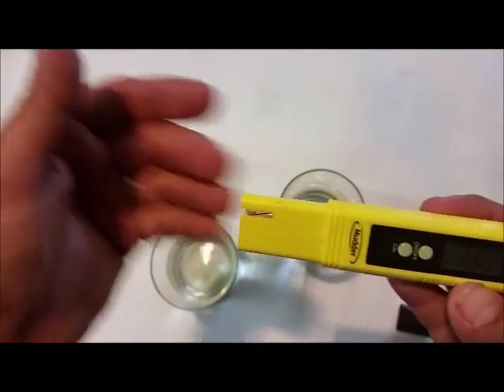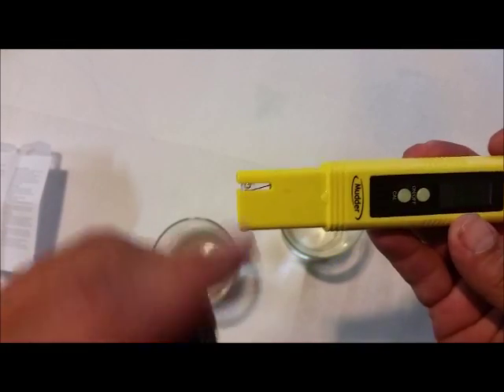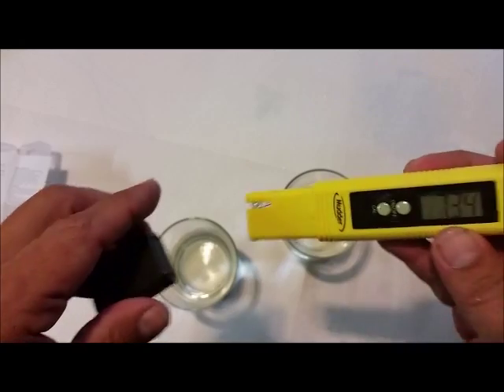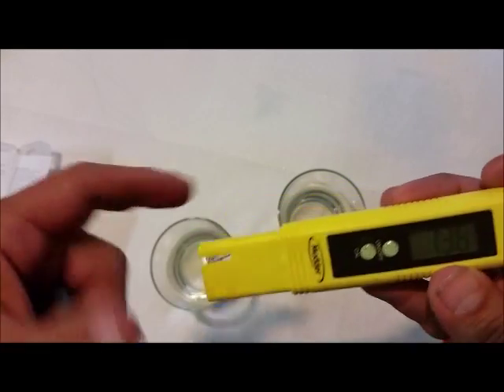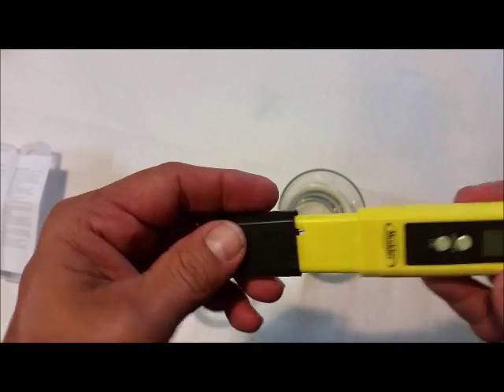And you can dry off the outside, kind of blow it off. But keeping that moist in there hurts nothing. If you get distilled water and rinse it off, and if it's a little moist inside there, it hurts nothing. It's good to help keep it from drying out anyway, it says. And that's what this lid's for. It'll help keep it from drying out.